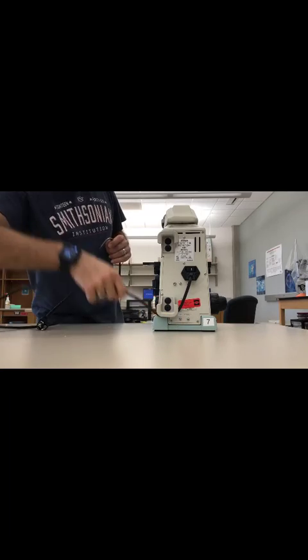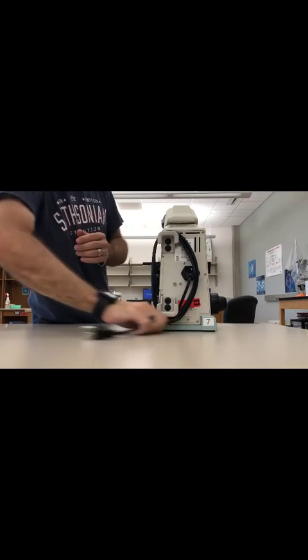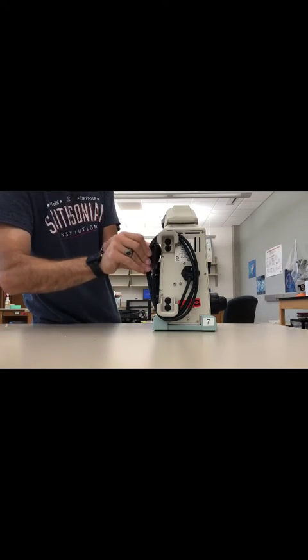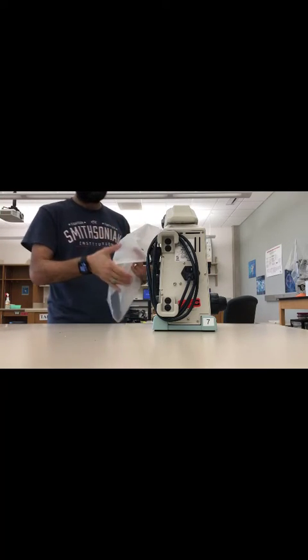Unplug the microscope. Time to coil it up.